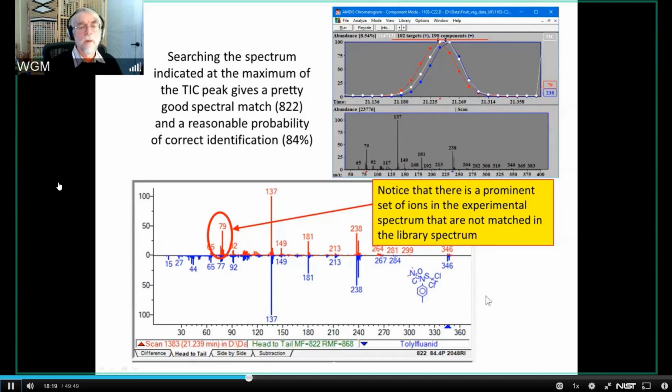So whenever you see something like that, you at least have the suspicion that maybe what you've got are two components that are overlapping. Now, AMDIS has already told us that. So in some respects, there's a little bit of duplicity going on here. But AMDIS has told us, in putting these two triangles up here, that there's two components there. So it's not surprising that we find this, but the question is, what is it? Well, if it's in the library we use for the target analysis at first, we may already know what it is. But it's often the case that it's not.